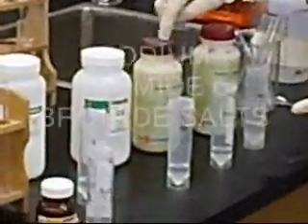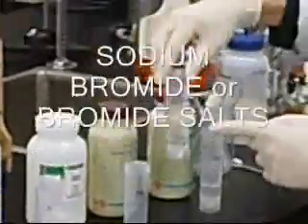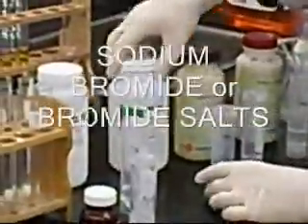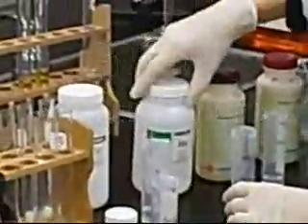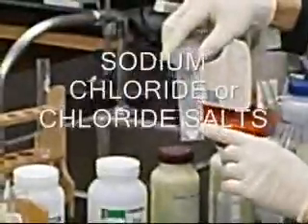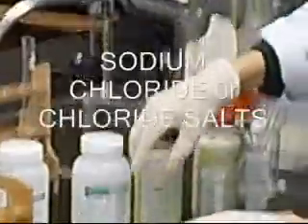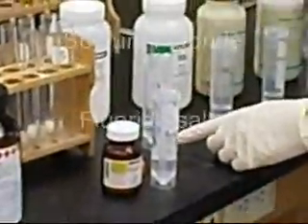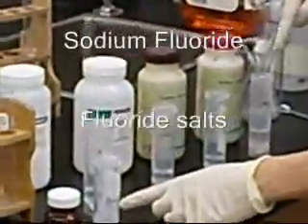I also prepared sodium bromide crystals dissolved into sodium bromide solution, sodium chloride dissolved in distilled water to get sodium chloride solution, and sodium fluoride. So I have all the halide solutions ready.